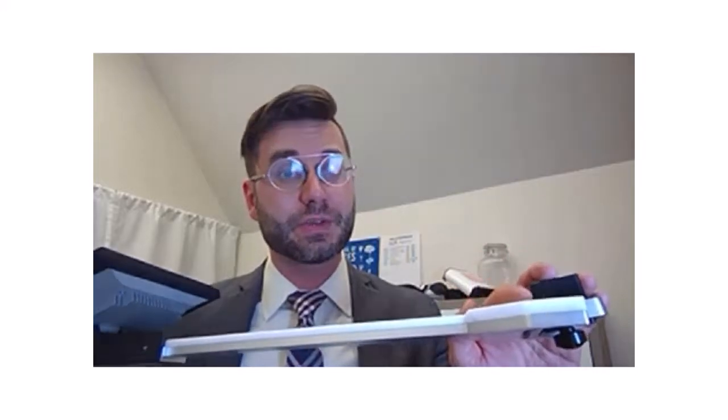There's a question: can I summarize the best practices to optimize the use where deployment is above the canopy, like on an aerial platform? We haven't developed a way of deploying above canopy yet, though it would not be a very difficult activity since this can be turned upside down. Honestly, it would just take being held into place. You would still get similar values. You would change the thresholding a bit, considering you're not getting the sun in the background, but you'll still be getting some reflected light.